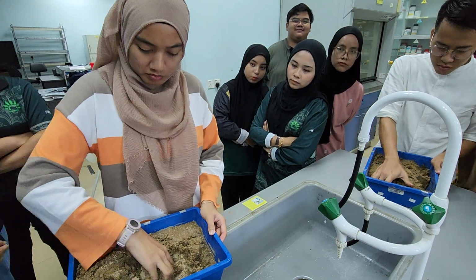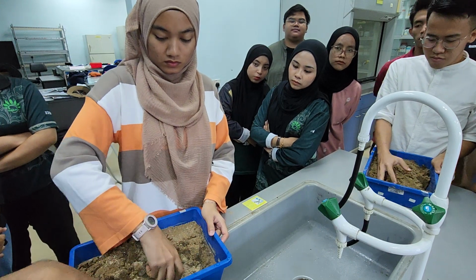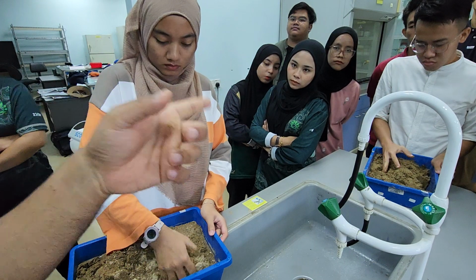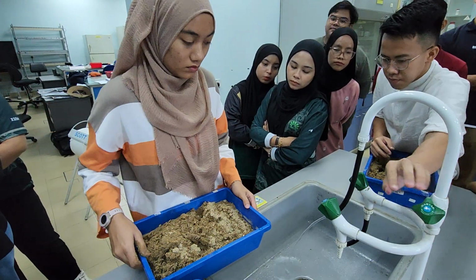I think you need to add a bit more moisture. Maybe do it half round. So this is why I want you to see this. Sometimes 2 turn is enough. Sometimes you need a bit more. So maybe for this one you need half, a bit more.